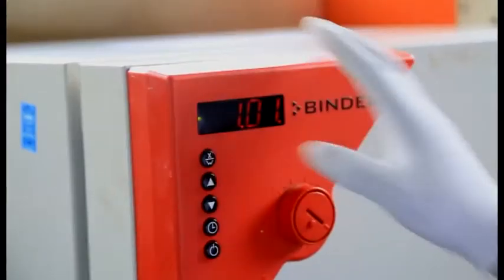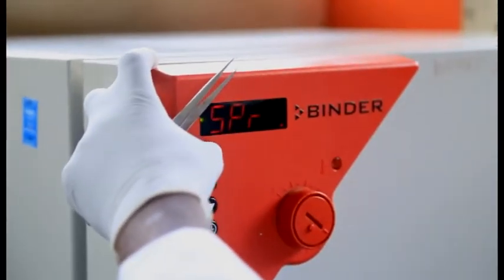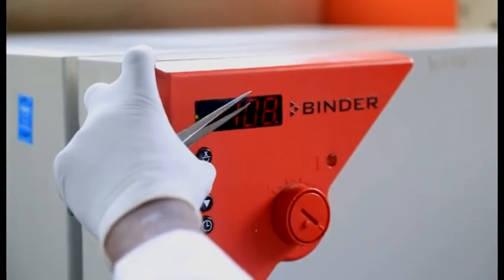And after 1 hour, you cool it in the desiccator, and then after that, you weigh. Having gotten 2 weights, there is the weight of the filter paper without the sample, and there is the weight of the filter paper with the filtered sample. Out of the 2 weights, you are able to calculate the total suspended solids in that sample. And that is all we do with that process.